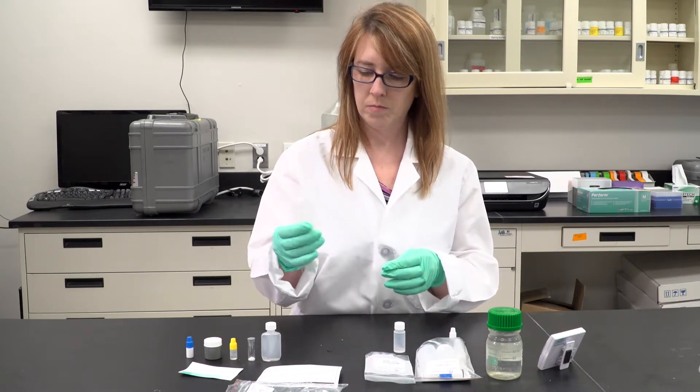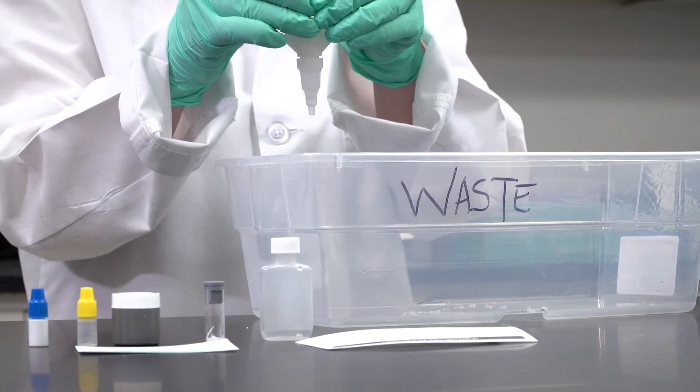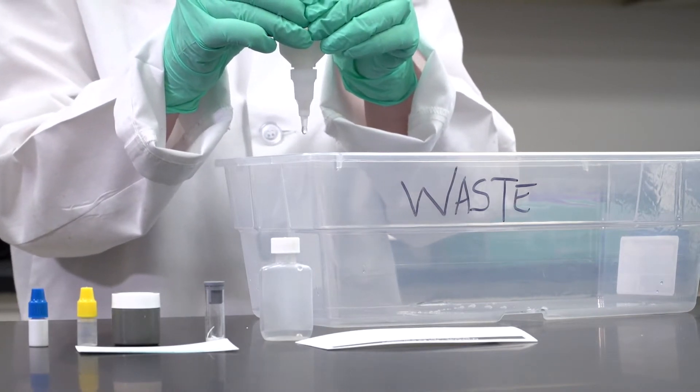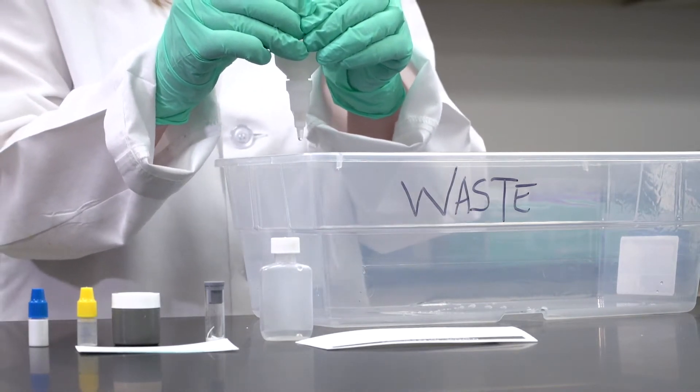Squeeze the bottle gently to expel liquid to waste, being careful not to release hand pressure, as this will cause air to rush into the bottle and may result in a loss of bacteria.